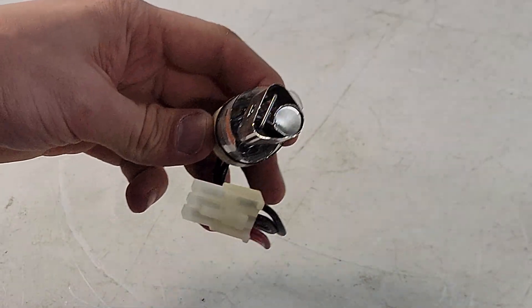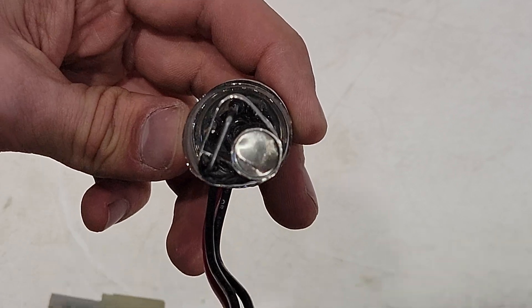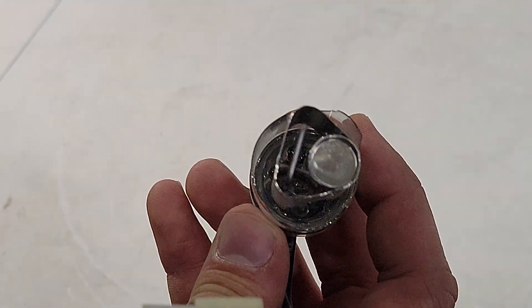I happen to have dropped this lamp and broke the quartz casing, which is why I'm dissecting it. This model is made for an old but popular optical spectrometer.